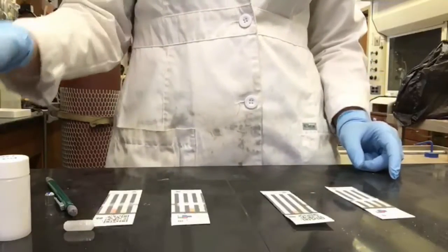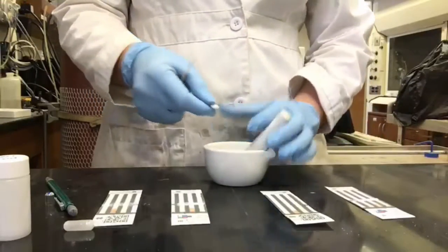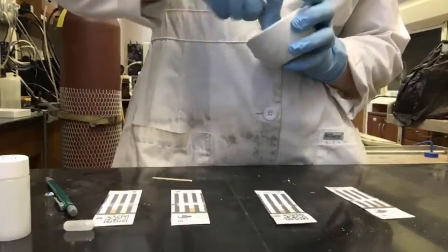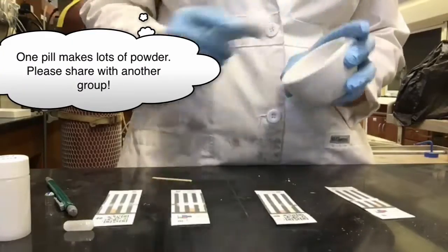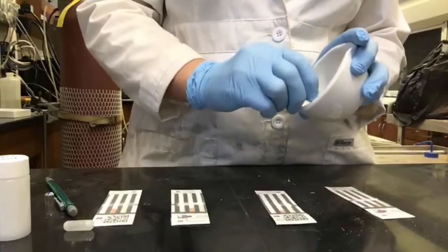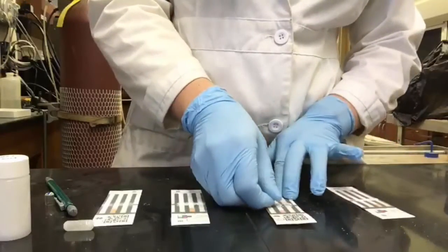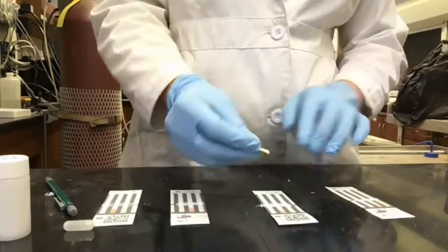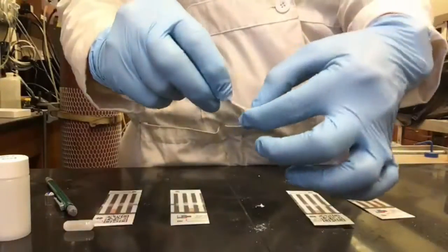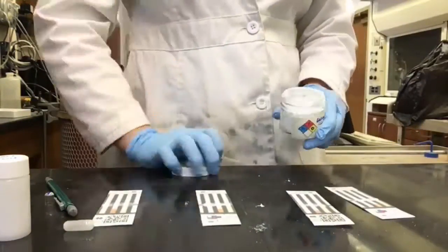In order to apply the aspirin tablet to the pad, you need to use a mortar and pestle. First, break the tablet, then grind it into a fine powder. Once the aspirin tablet is pulverized, you can apply it to the card using the wooden spatula. Make sure you break the tip of your wooden spatula off so that you don't contaminate your aspirin with other components from previous pad applications. Between applying each substance, break the tip off of the wooden spatula so that you're using a clean spatula each time.